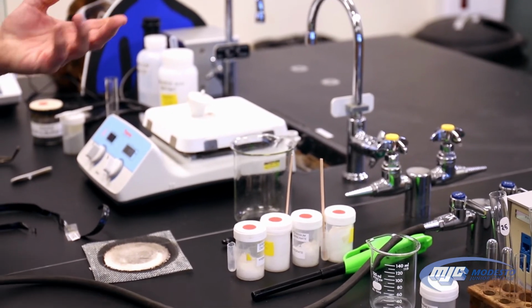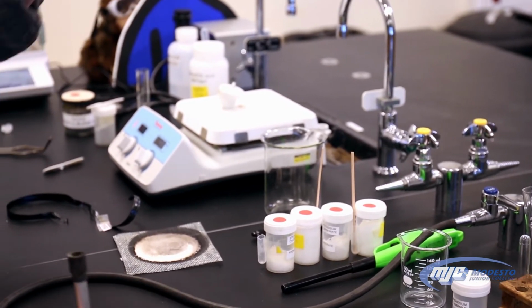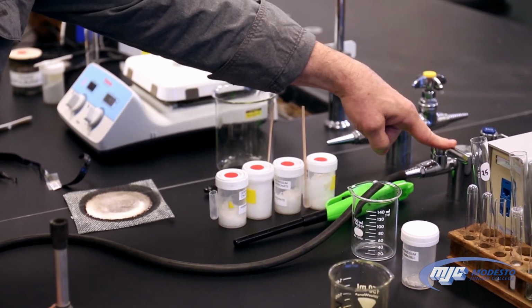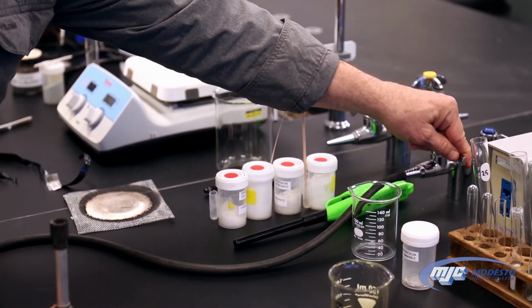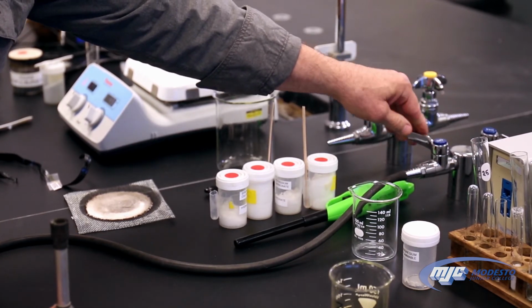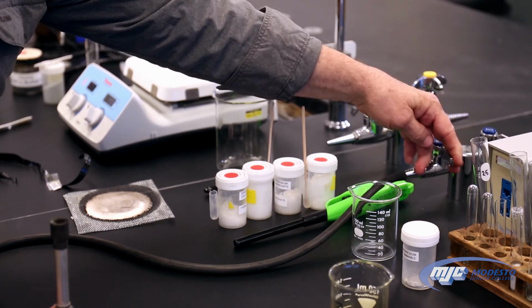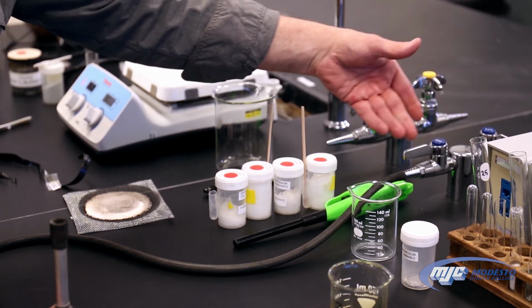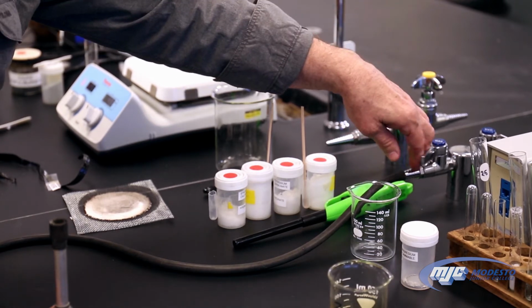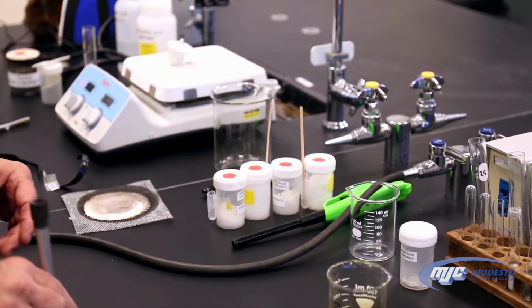A Bunsen burner basically has 3 controls, guys. The first control is the handle on the valve. And this handle, if it's perpendicular to the nozzle, either way, that means that the gas is off. It doesn't matter which way. If it's parallel with the nozzle, that means the gas is on. And that's all you use the handle for, either to turn it on or turn it off.